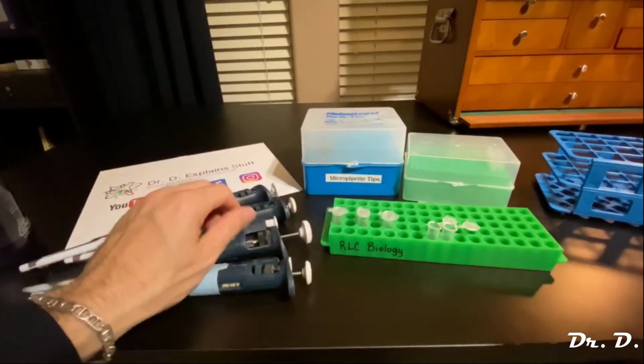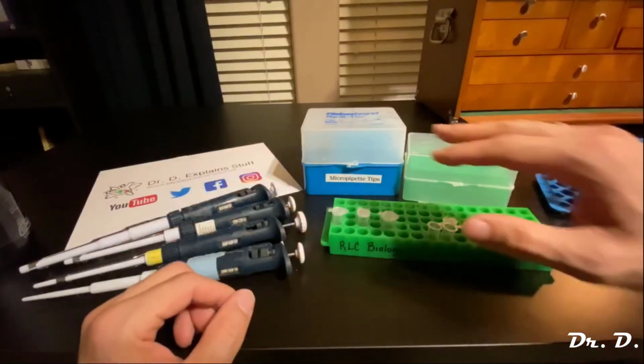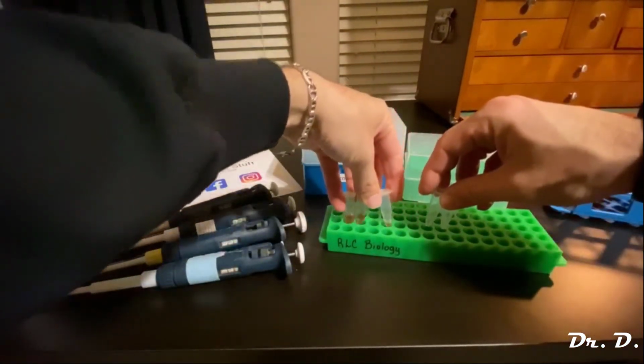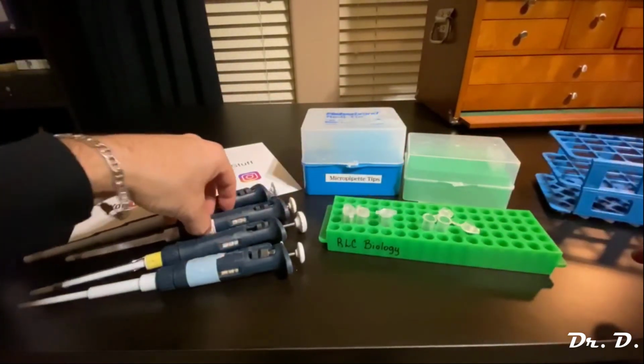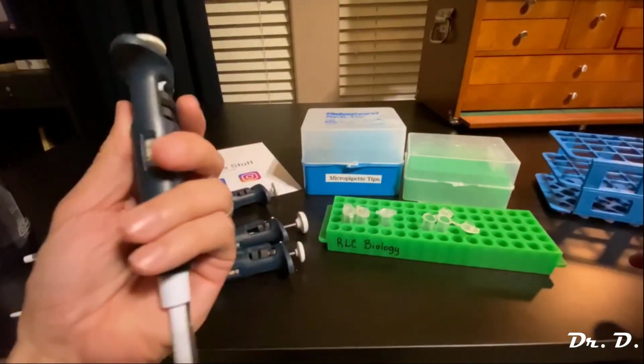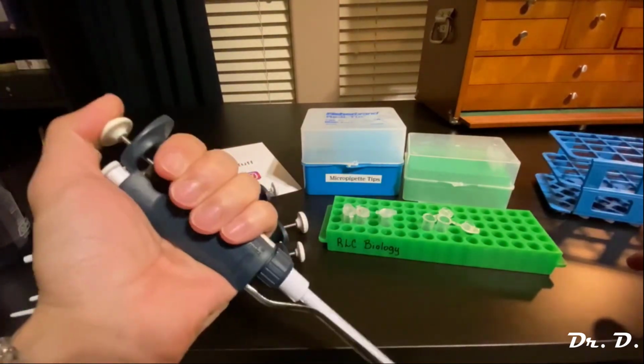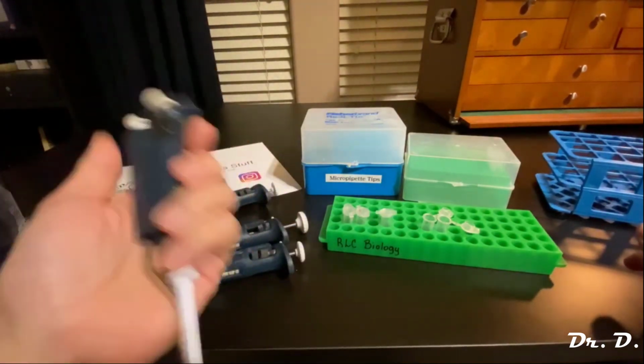All right, so hopefully that made a lot of sense for you. This is what I was working with. These tools were in my hands daily when I was a PhD student at UT Southwestern. I was all but getting carpal tunnel using these every day, all day.